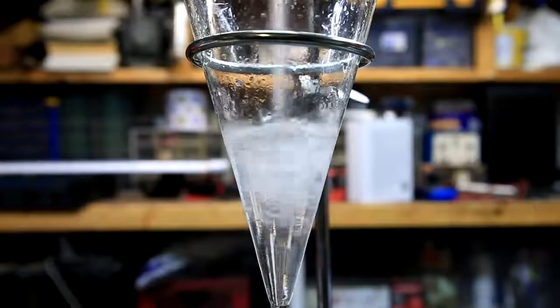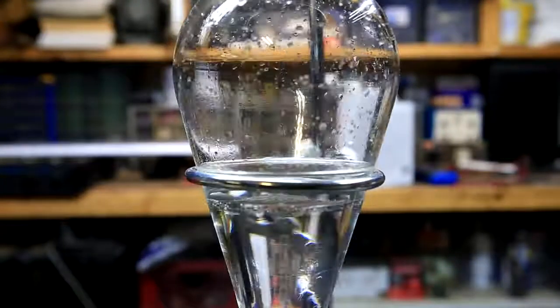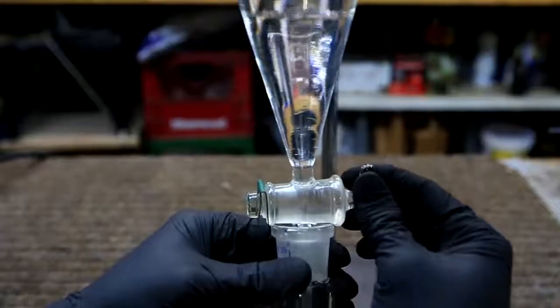The DCM washings were poured back into the separatory funnel, dried using saturated sodium chloride solution and then drained into a flask containing calcium chloride.